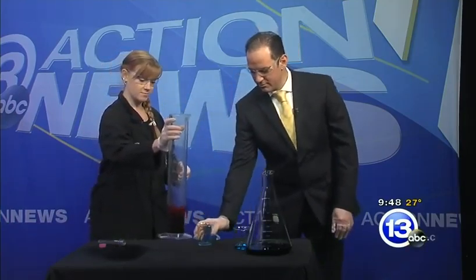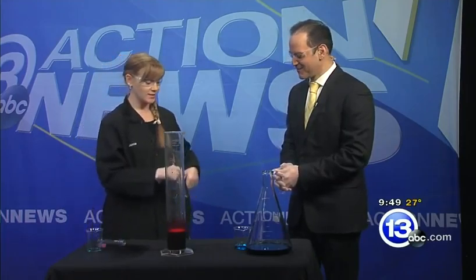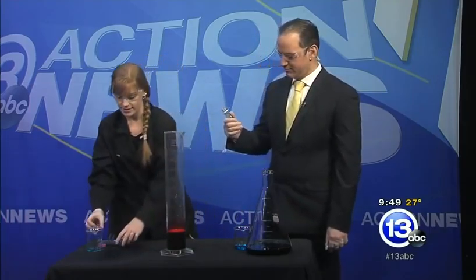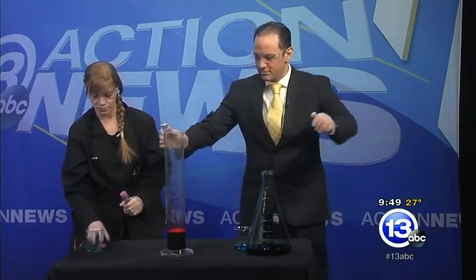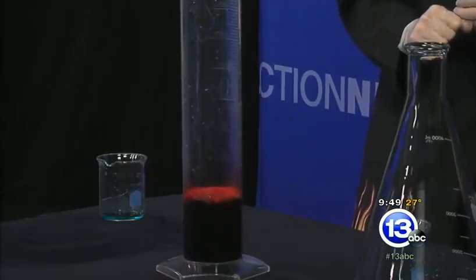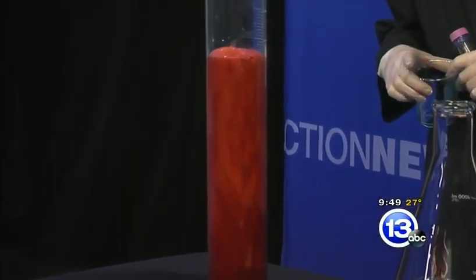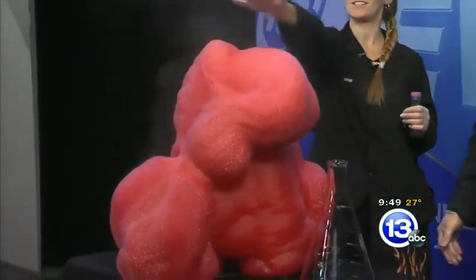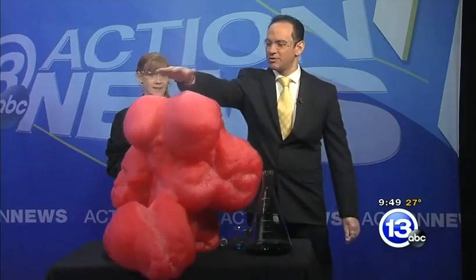So you have to swirl it around, mix it up. Now I am going to give you this — it's just a catalyst, okay. It's going to accelerate the task at hand, which is breaking down our hydrogen peroxide. Accelerating all the way up the tube, and that is going to make a mess. We have the same reaction occurring — we're releasing that oxygen gas. You can put your hand up there. It's just like real molten lava. It's really warm. I just added food coloring; that's where that red coloring comes from. But what we're seeing is an exothermic reaction — a really, really hot reaction is occurring.